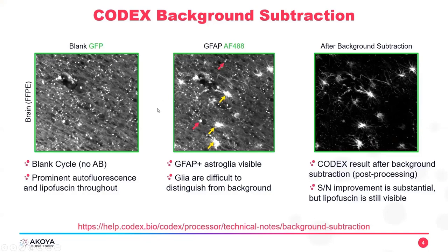So what happens in your CODEX experiment is you take your actual signal image, this middle image, and you subtract the background image, which is the one on the left. And as a result, you get what you can see here on the right-hand column, your background subtracted image. You can now see in this image much clearer your glial cells, as indicated with yellow arrows. And you see the signal to noise is overall much better. Your background is almost black. However, there are still many little particles left, and you can see them here with the red arrows, as elsewhere throughout your image. So while the background subtraction is a very powerful tool, and it indeed helps you to increase the signal-to-noise ratio of your image, it's not perfect.